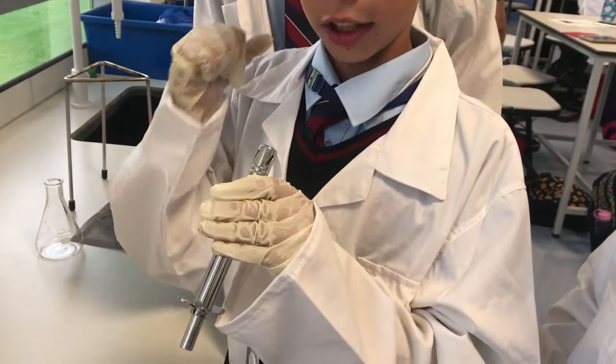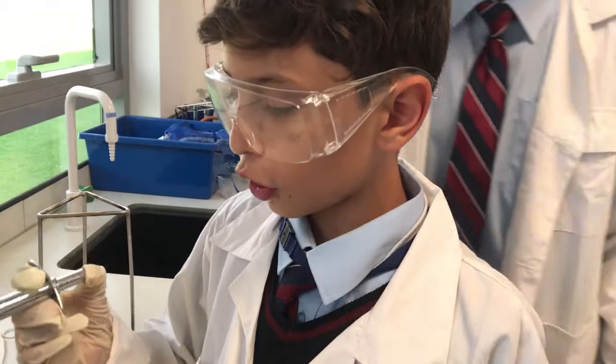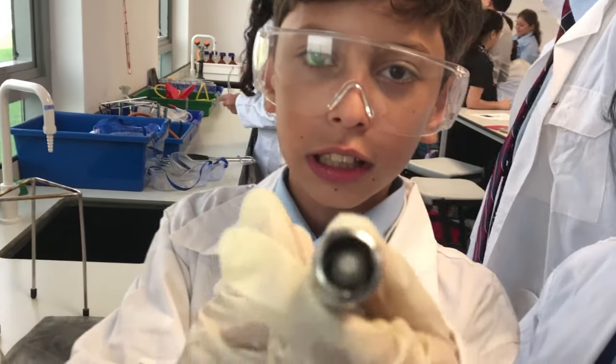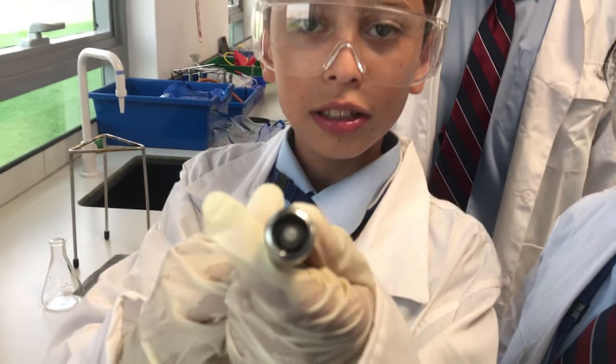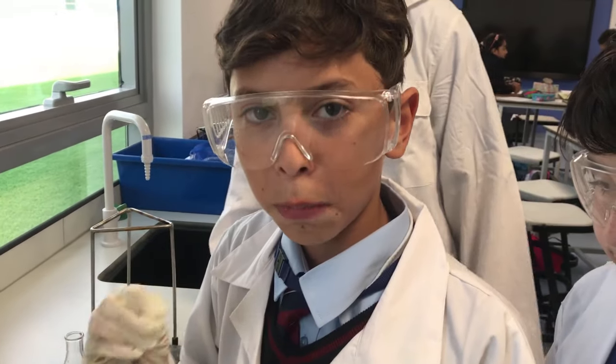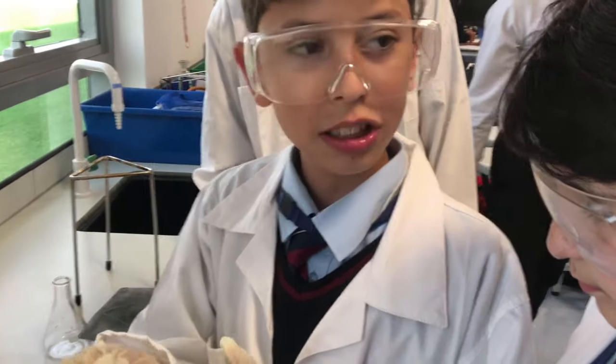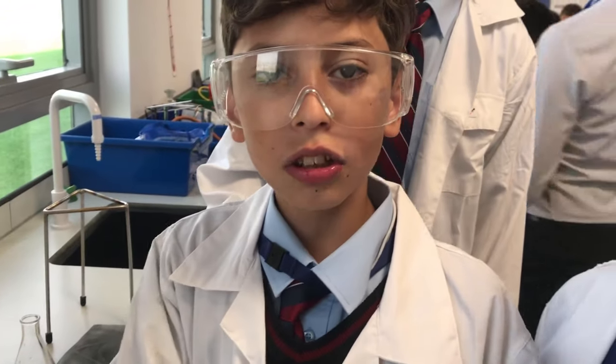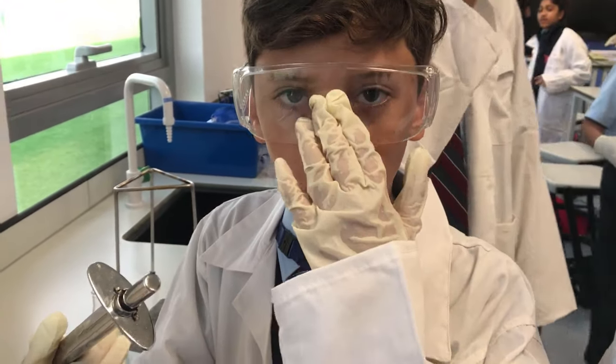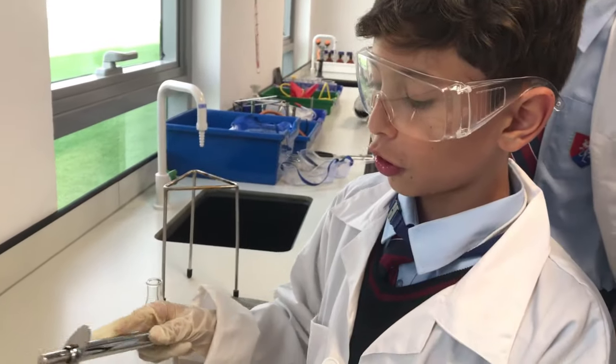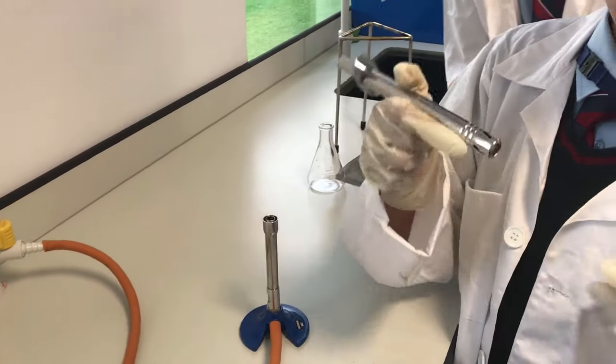And as you can see, I wanted to show you this, but Mr. Easter kind of stopped over me. But as you can see, there's a little spark there. That's the thing, and that's not a spark of fire, that's a spark of flint and steel, and that's the only thing that we will be that will light your thing, that's the main thing. Or you can use a lighter, you know, the one which you make barbecues with.